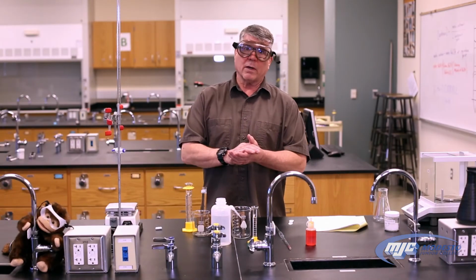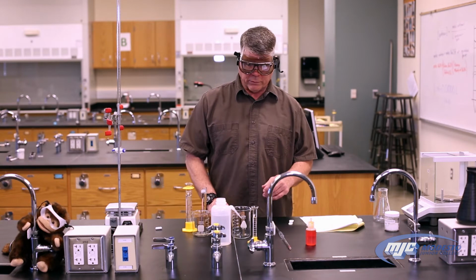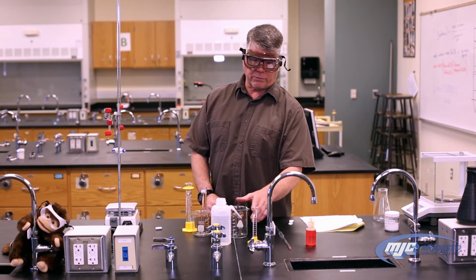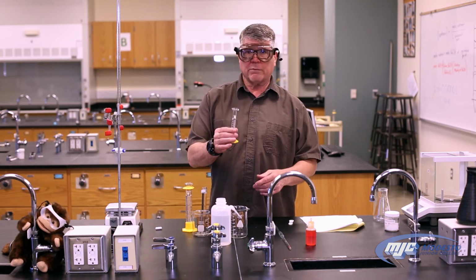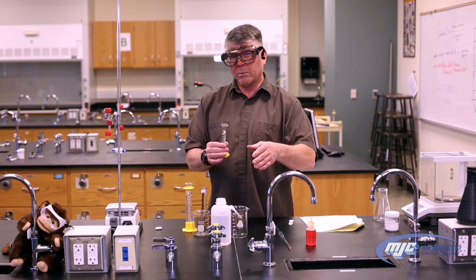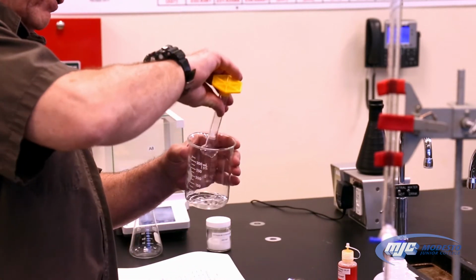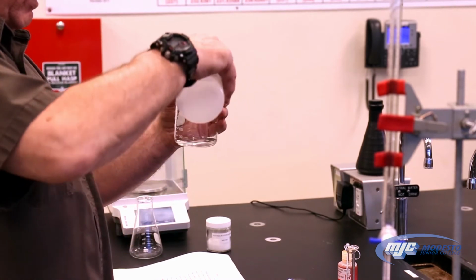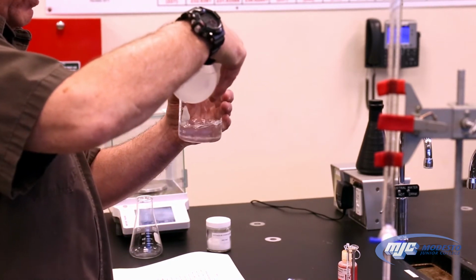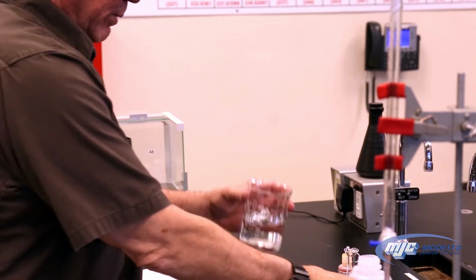All right, guys, so this is part A of the acid-base titrations experiment. First thing we're going to have to do is prepare our stock solution of sodium hydroxide. I have a little more than 10 mL of 6 molar sodium hydroxide. For this part, we're not measuring anything carefully. We don't care. So I add this to my 400 mL beaker, and I'm going to add roughly 200 mL of deionized water. So I'm just going to use the marks on the beaker here. Bring it up to about 200 mL. There's my stock solution. Easy as that.